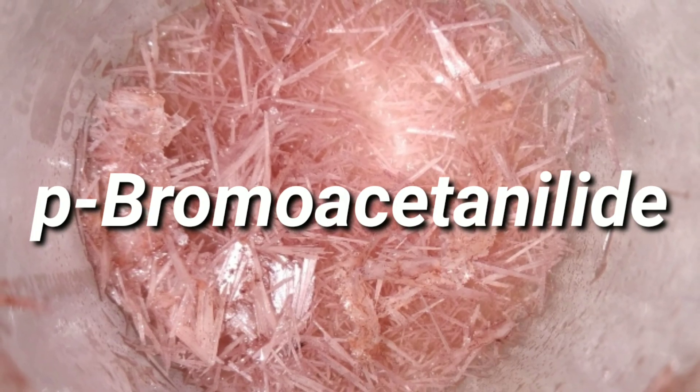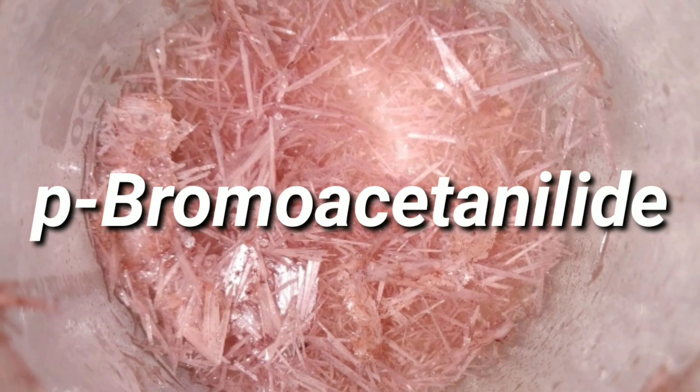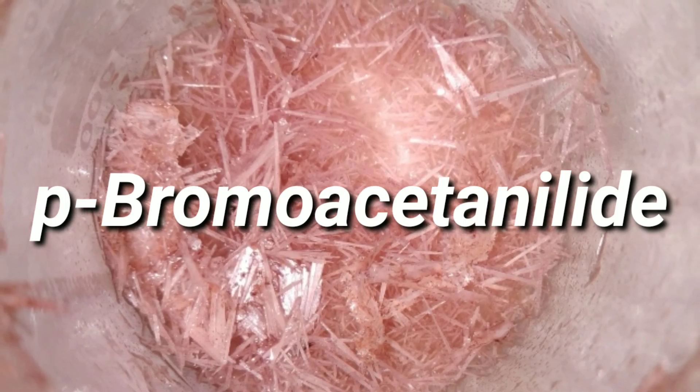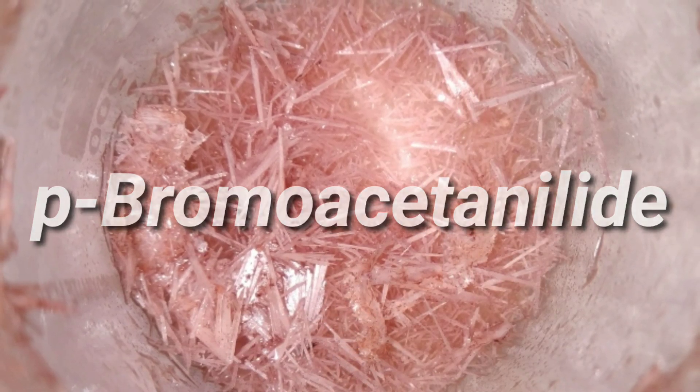Hello friends, in this video we synthesize parabromoacetanilide without directly using molecular bromine.